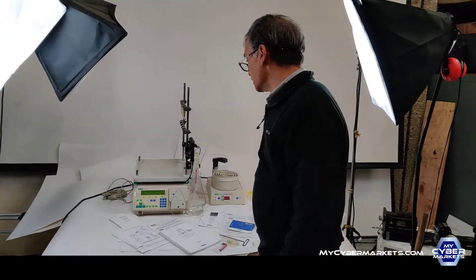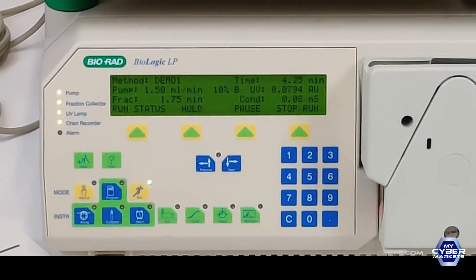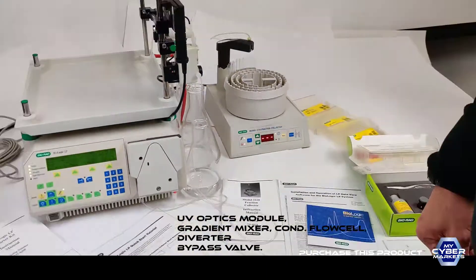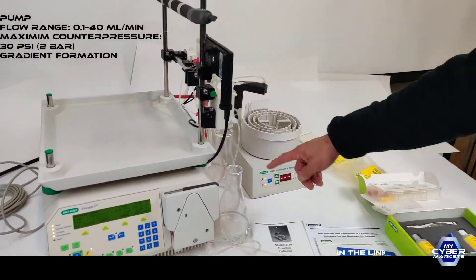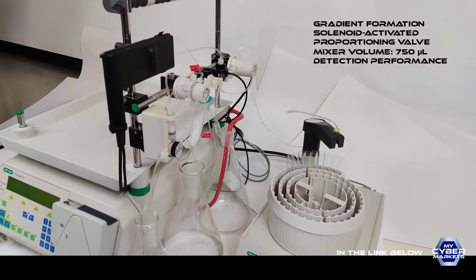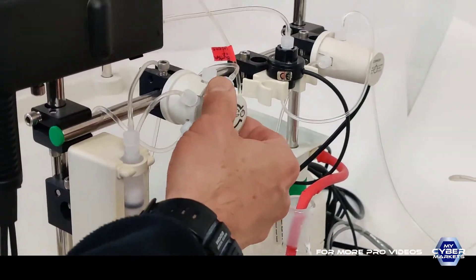I'm going to show you the BioRad BioLogic low-pressure chromatograph. We have it here with its fraction collector, the 2110 model. Right now we have loaded with water all the channels — we have primed. This system comes with a mixing station and a diverter valve for the injection.